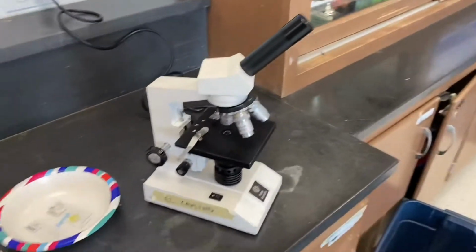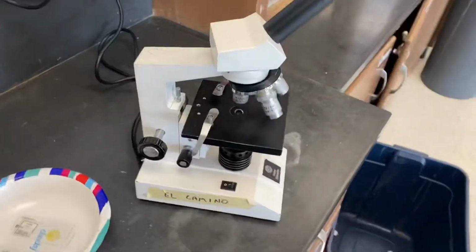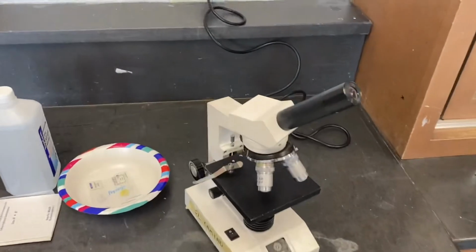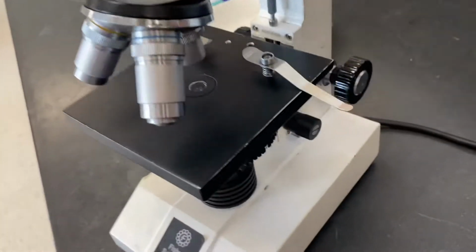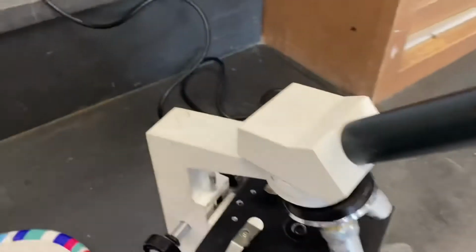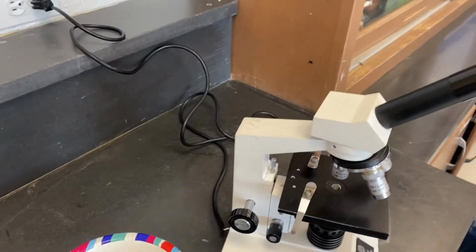All right, this is a simple game. It's all about the CLM, or compound light microscope. By now you've used it or you've studied it, and you are going to learn to love it. All right, there it is, a good looking CLM. So name that part. What I'm going to do is point you to a part, I'll give a description, and then you are going to name that part.